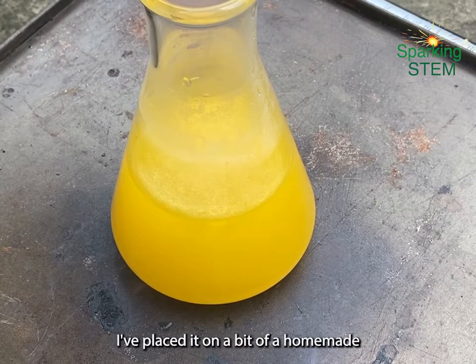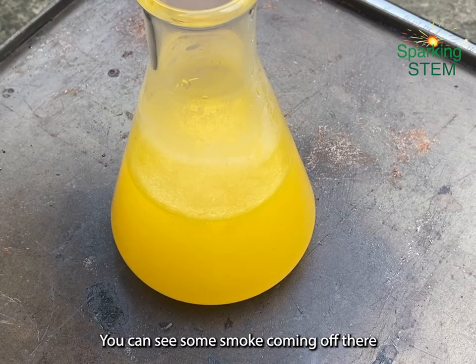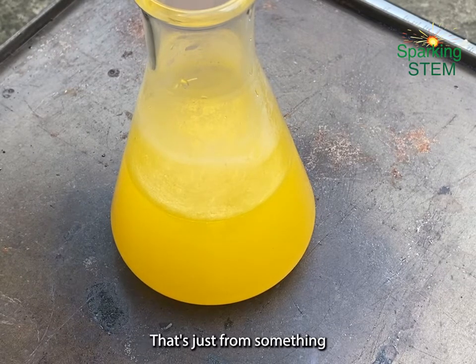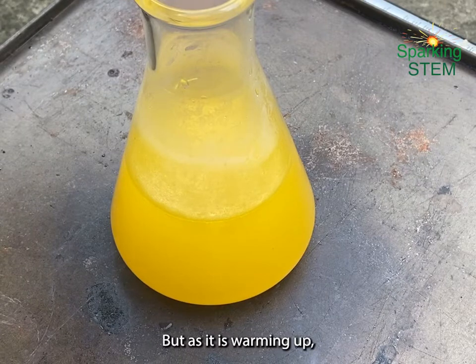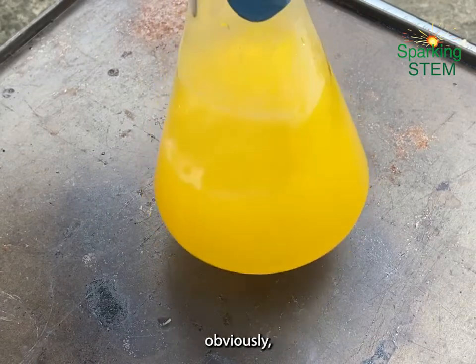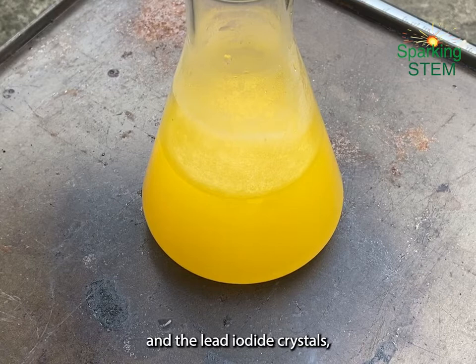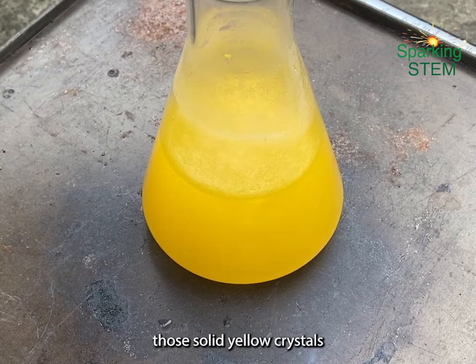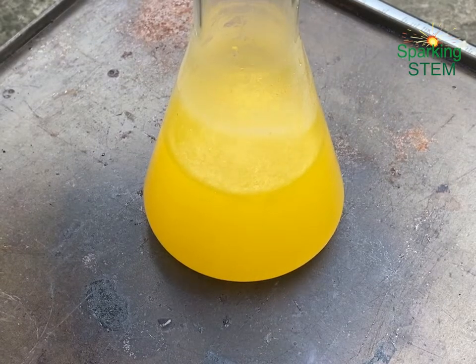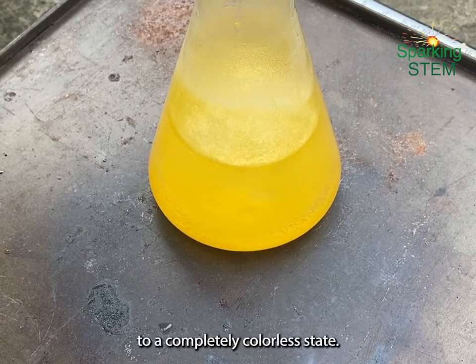So here it is. I've placed it on a bit of a homemade hot plate, really. We're still outside. You can see some smoke coming off there. And that's not from the chemical reaction, that's just from something on the hot plate. But as it is warming up, the temperature of the solution is increasing, obviously. The particles are getting more kinetic energy, and the lead iodide crystals, those solid yellow crystals, are starting to dissolve into the solution.